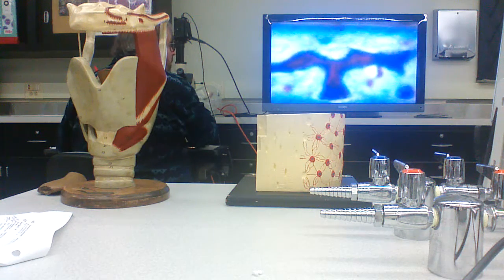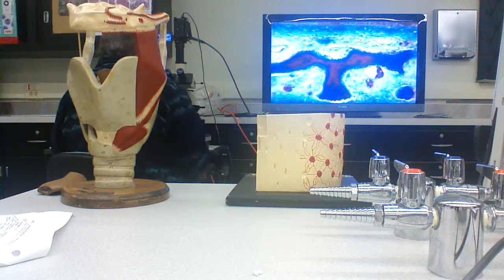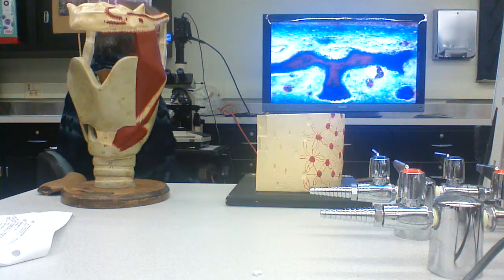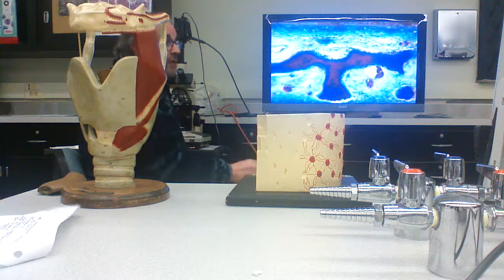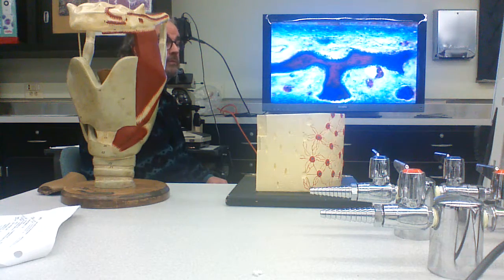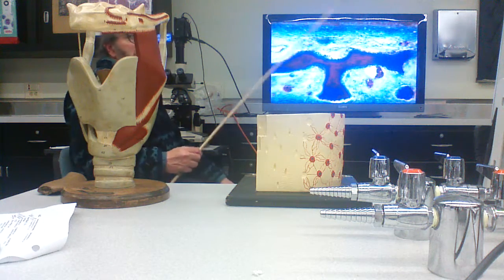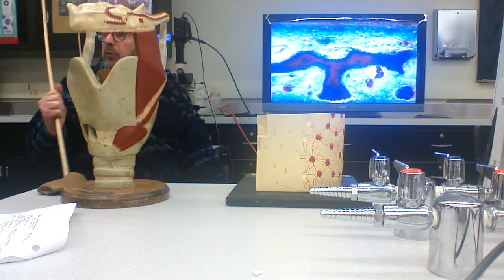In that you're going to make spicules of that so-called spongy bone or trabecular bone. You make trabecular bone. And this is formation of bone in the head of an embryo, right? And if Nick would be kind enough to go get that exploded skull in there.